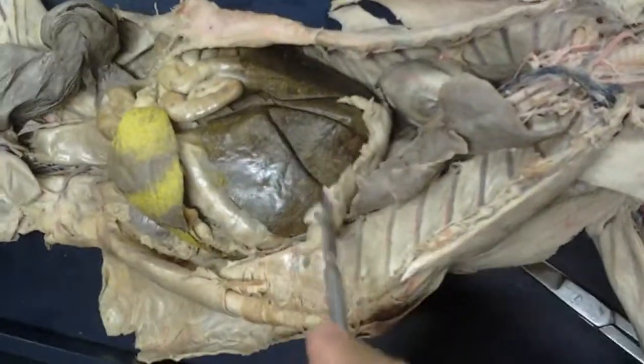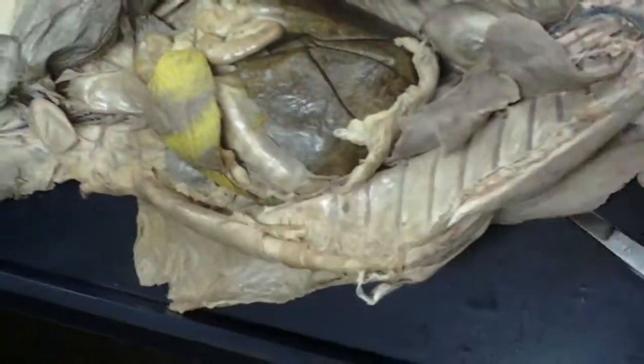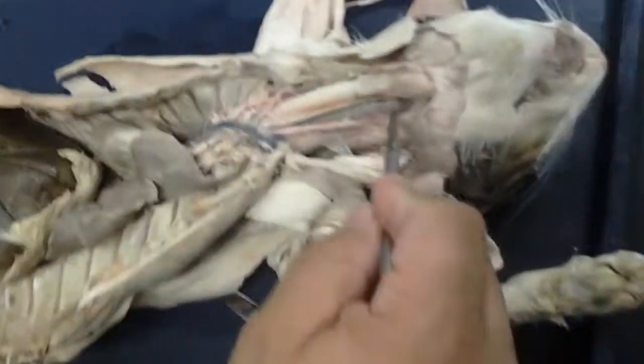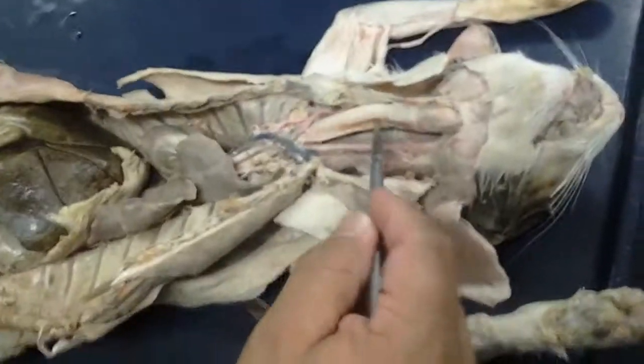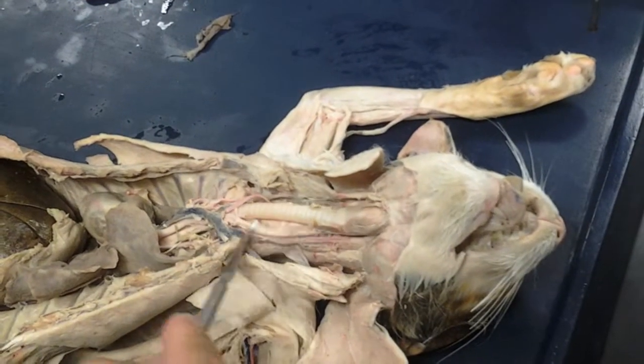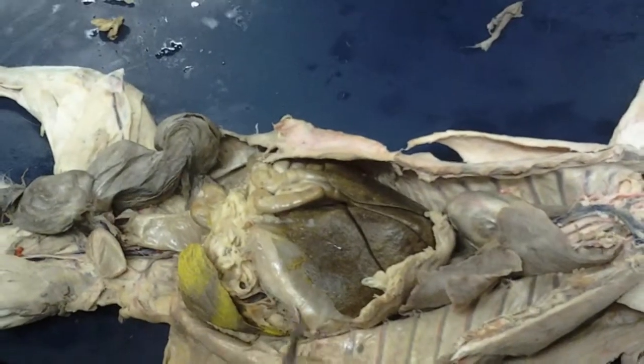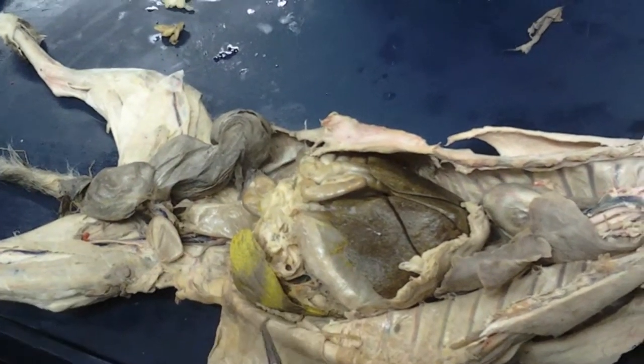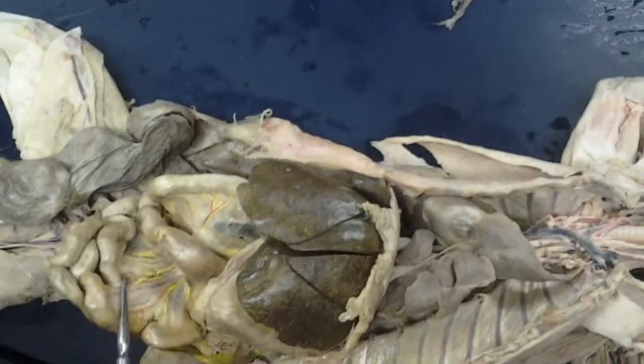Getting into the digestive system now. Obviously we would start back with the buccal cavity. That food would pass through the pharynx, again the oropharynx and the laryngopharynx, but this time it would end up in the esophagus. So there's our esophagus. Into the stomach, which is here. Doesn't look like you cut the stomach, so you don't see the rugae, but normally if you were to open this you would see those rugae, those muscular ridges. Okay, so that would be the stomach. From the stomach it would pass into the duodenum.